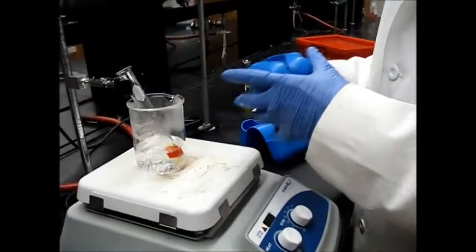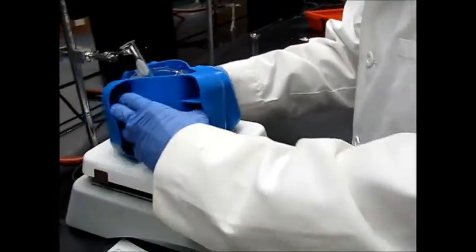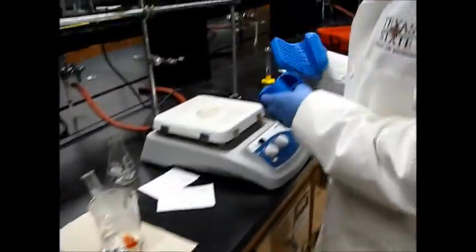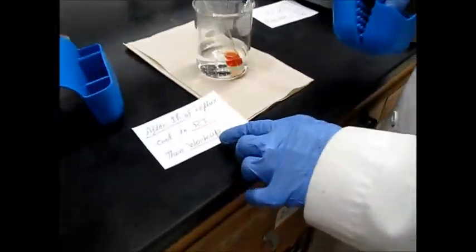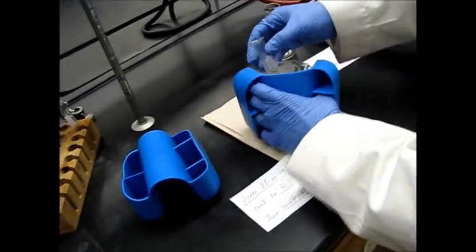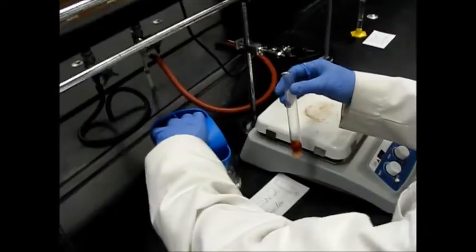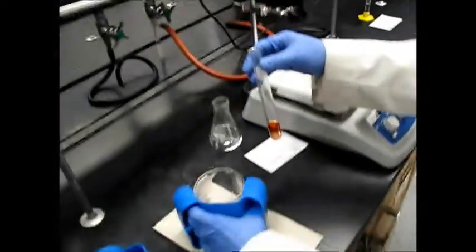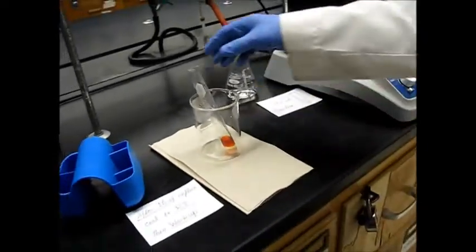It's very hot right now, and you can use 2 of them like this, and then let it cool down to room temperature before workup. And we can also remove the hot water from here. Be careful, it's very hot. And then let it cool down. Once it cools down, here we will start workup.